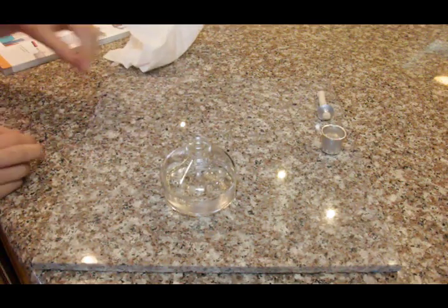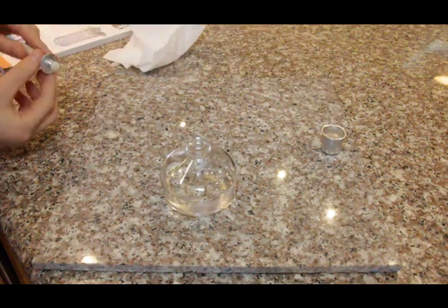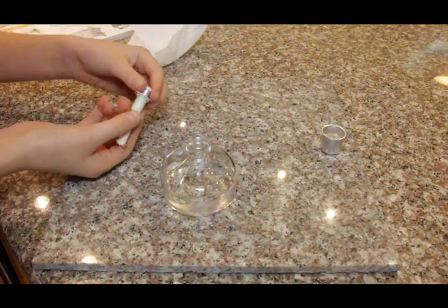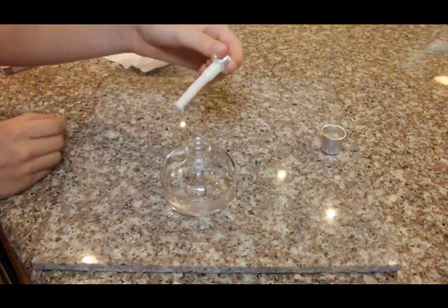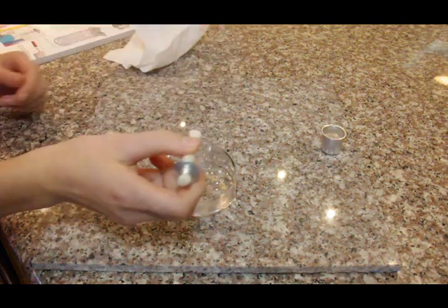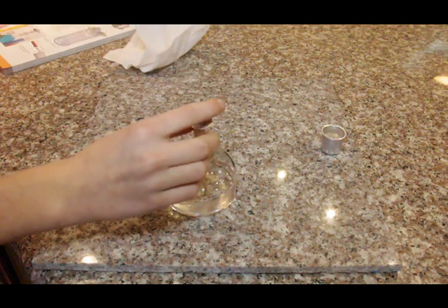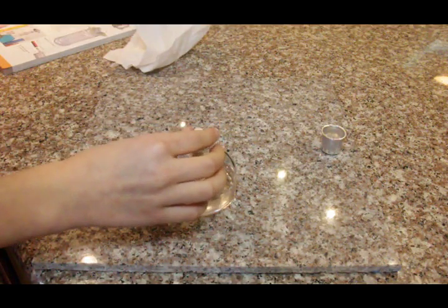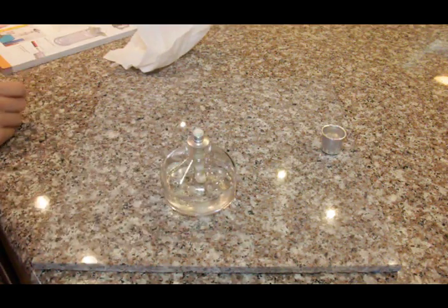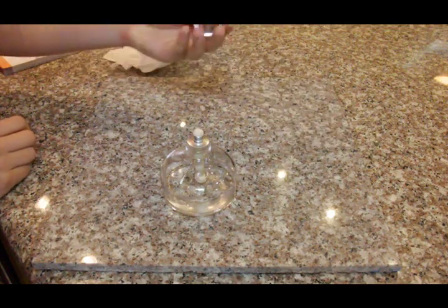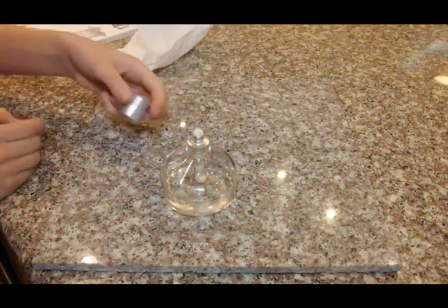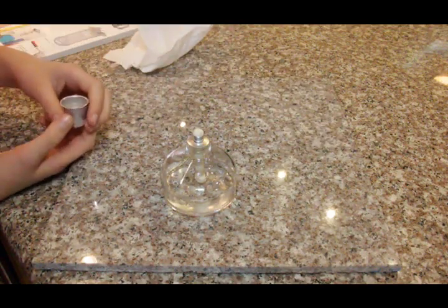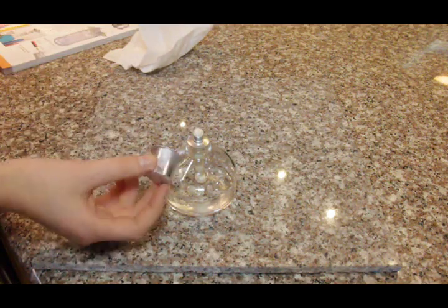Next, you can insert the wick by just placing it in. And then you can place on the burner cap, which is a metal cap.